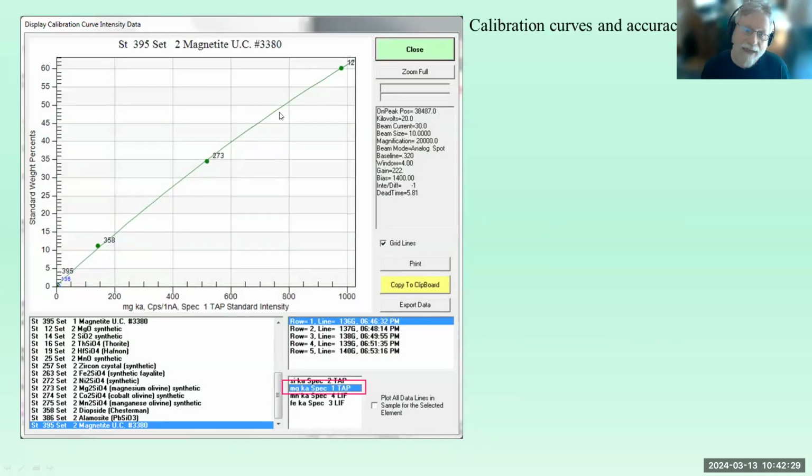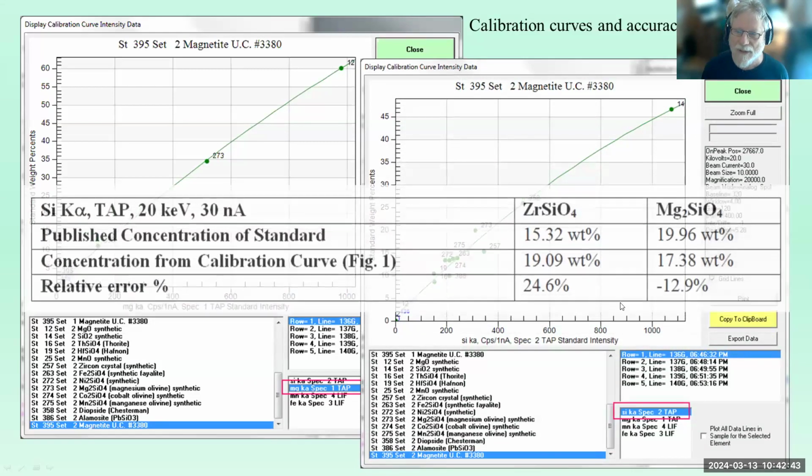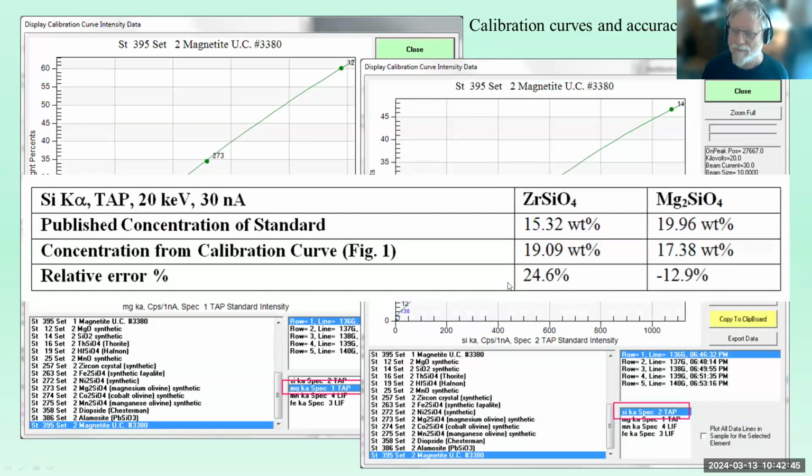Okay, and just to belabor the point, here's an example of a calibration curve. It actually isn't too bad. This actually looks pretty good. This is magnesium K alpha in a few materials here, as you can see. Not too bad, but if we look at silicon, it's not so great. And in fact, if we look at the errors, we're talking between 10 and 25% errors. So this is not uncommon in any material.